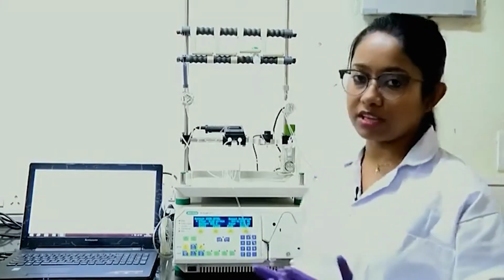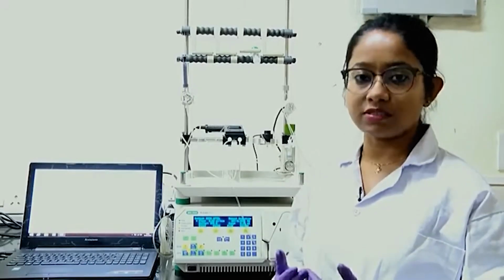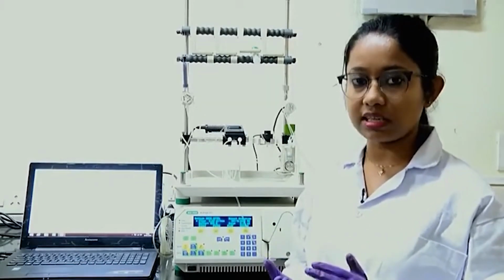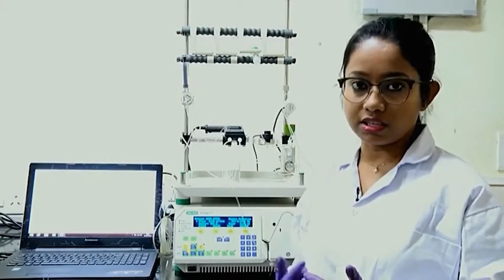So, why do we have 10 millimolar of imidazole? In the wash buffer we have this small amount of imidazole to avoid any kind of non-specific binding. As I have mentioned, my protein has a 6x histidine tag, so 6 consecutive histidine residues are present at the N-terminal portion or it might be at the C-terminal portion. But there might be some proteins inside the cell which also have a few histidines, not necessarily 6x, but it might be 2 or 3 residues of histidine consecutively, and they can also bind to these nickel beads. But we do not want those proteins.